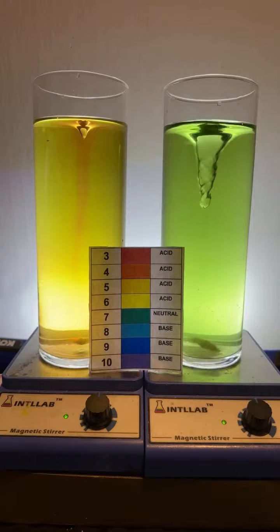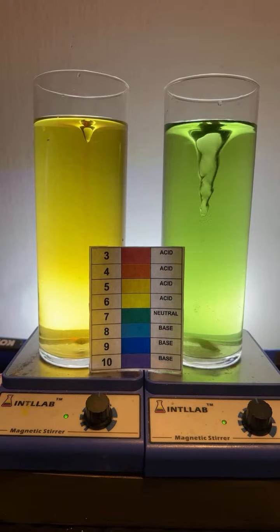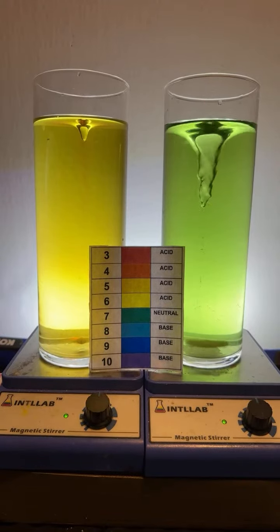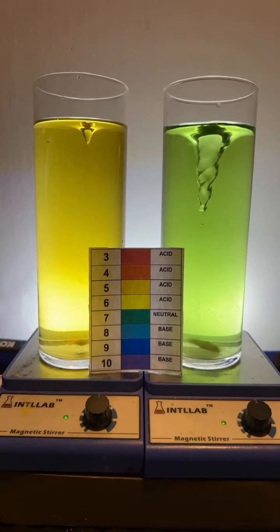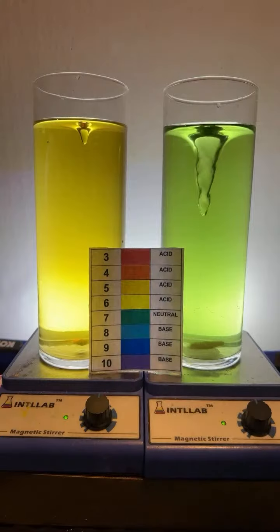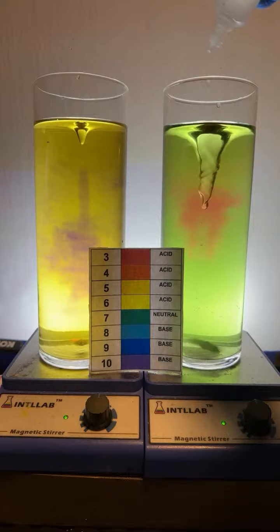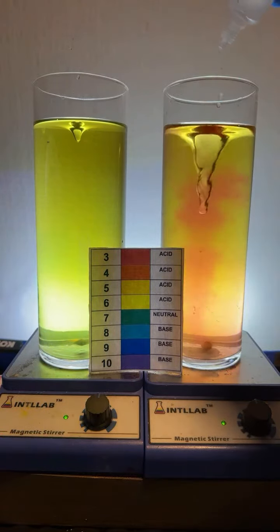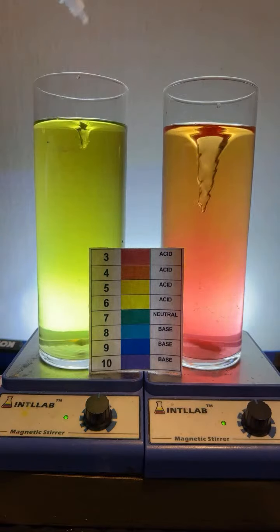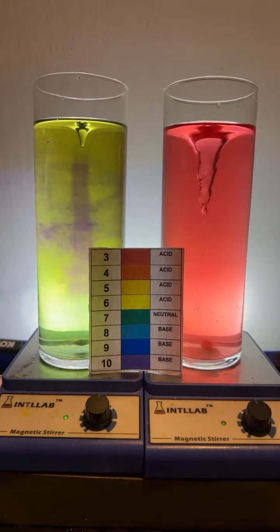What happens is you add one drop of base to a very acidic one, with the speed of the spinner being dialed down a bit with each drop. Okay, let's try it. Here we go. Over here, I'm going to try to get this teal. Teal's tough, y'all. Teal is a really tough color to get. But I'm going to try. I'm also going to try to do that other experiment over here. I'm doing two things at once, so forgive me if I lose my brain here a second.